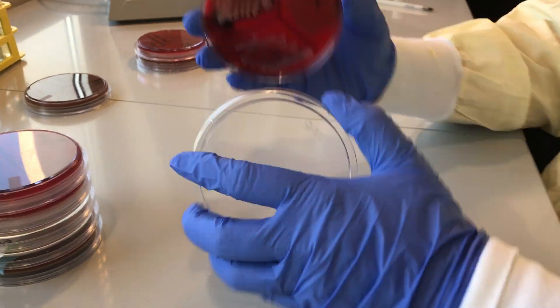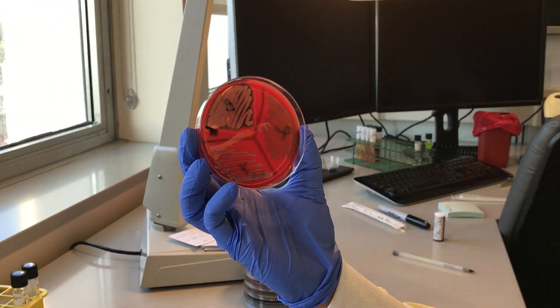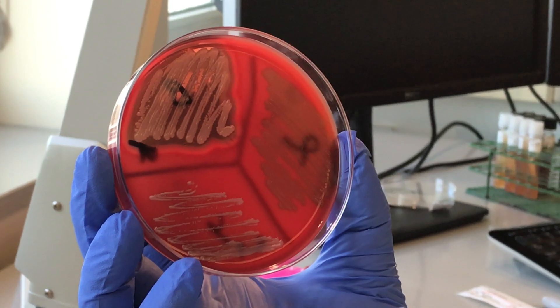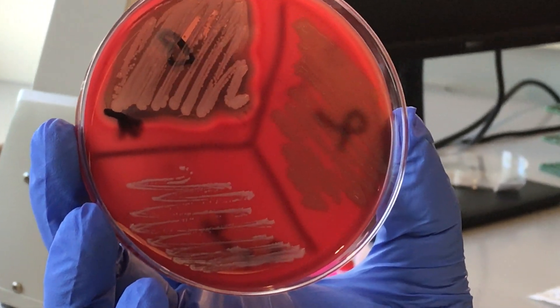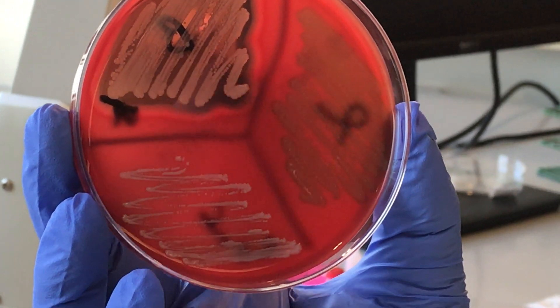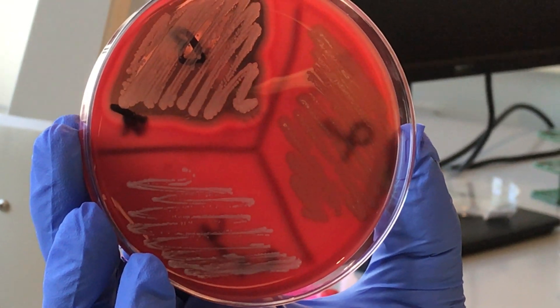With just hemolysis — you can see the hemolysis here. This is beta, alpha, and gamma non-hemolysis. You can see the beta is really beta.